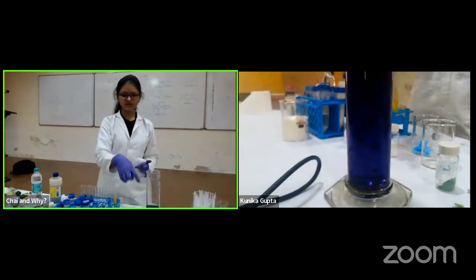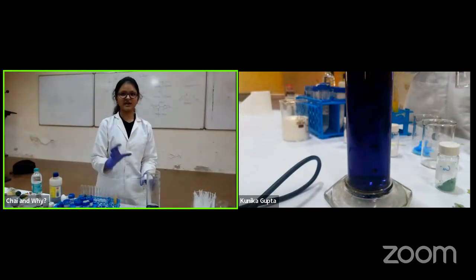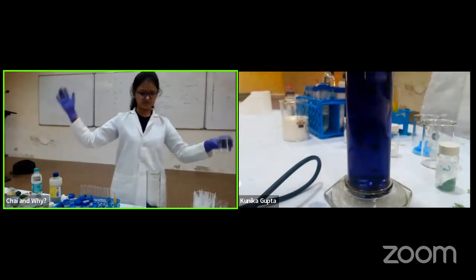Okay, so now I will drop a piece here. Let's see if it doesn't spill. I can't even hold it in my hand. You can hold ice like that, but you cannot hold this, because it will literally give you cold burns. And this often happens to us.